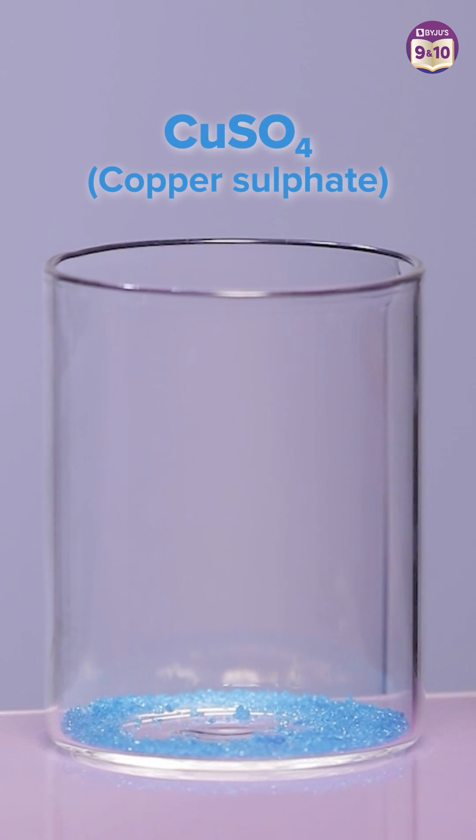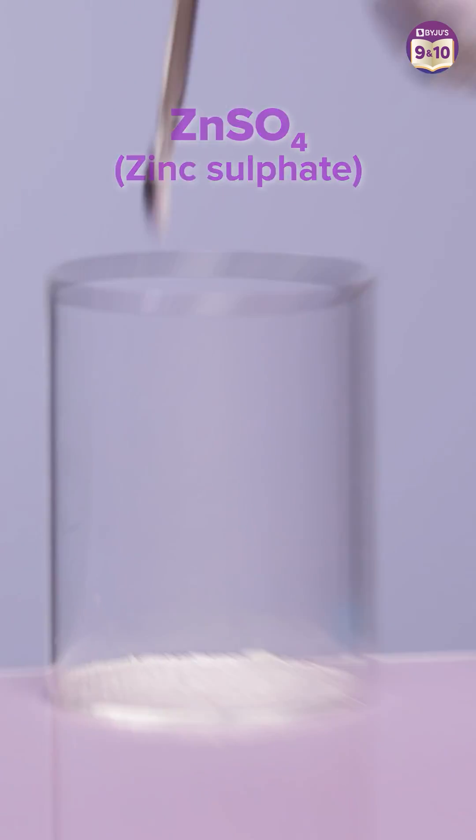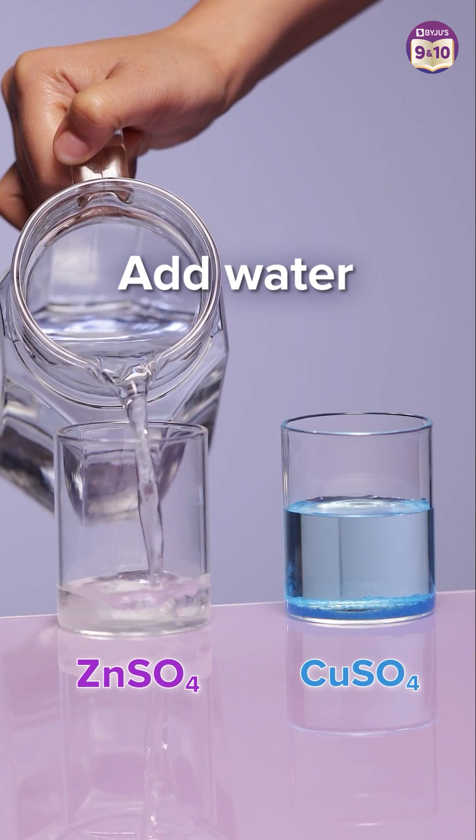First, we added some copper sulphate to a beaker and zinc sulphate to another. Then we added water in both these beakers.